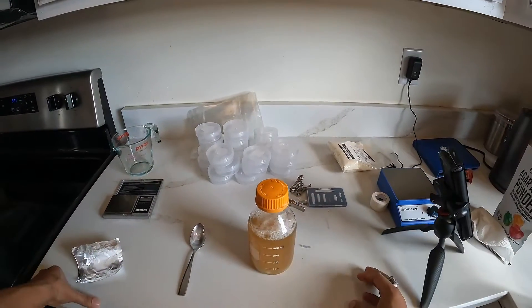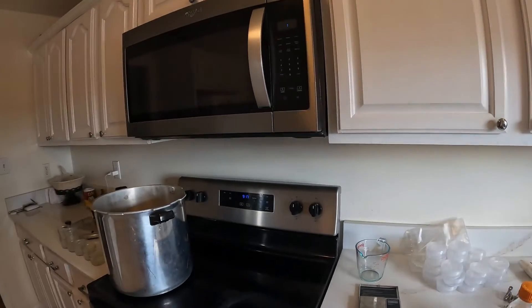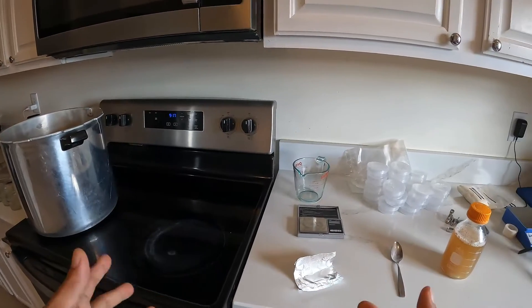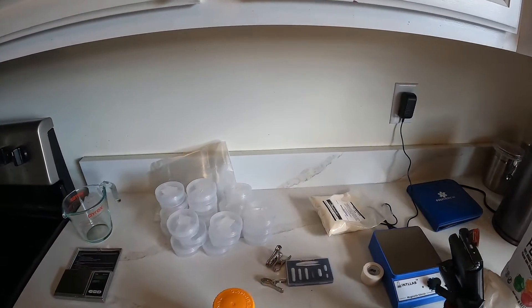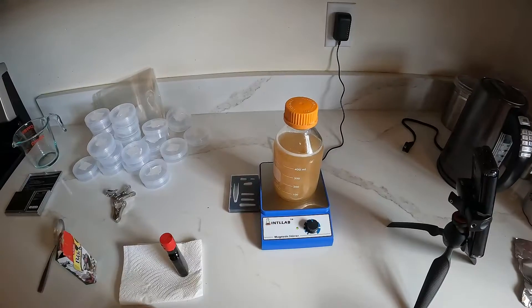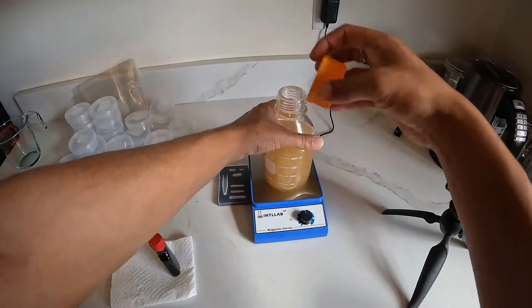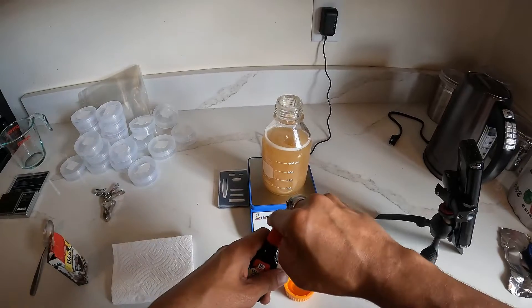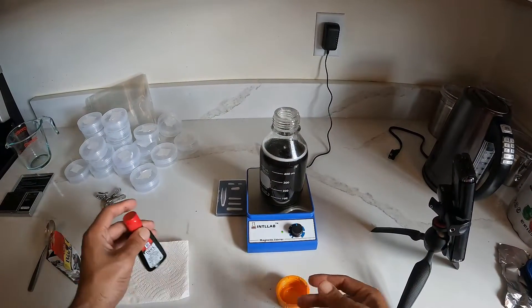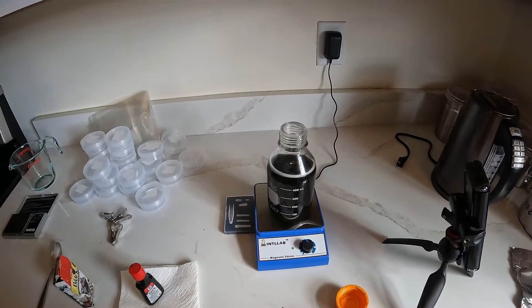You can put it on the stovetop — I have some videos on that procedure, mixing it together on the stove — and you can also put it into the microwave. For both of those you really need to watch to make sure you don't get any boilover or you're going to have a huge mess. But I would encourage you to invest in one of these magnetic stir plates and the bar. Let it spin for about 10 to 15 minutes. Then, optionally, you can put some food coloring in there — black is a good color to use, about three drops. If you don't want to use food coloring but still want that effect, you could use activated charcoal to make it black.